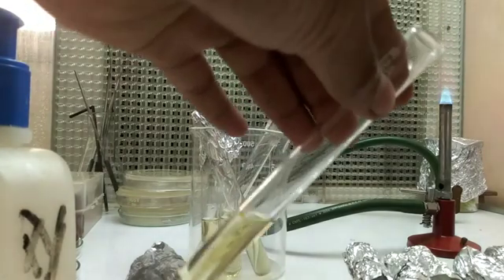Repeat this process for all test tubes. One test tube should be marked as control — it should not be inoculated with any bacteria. This control is used to check the purity of the culture. As you can see, the control test tube shows a completely clear solution of nutrient broth.